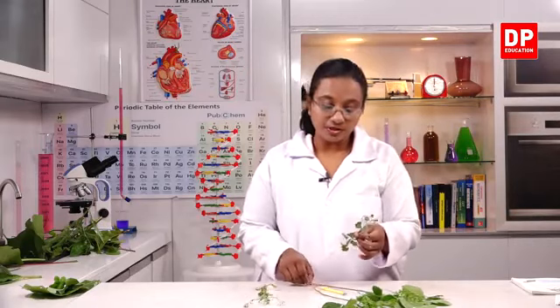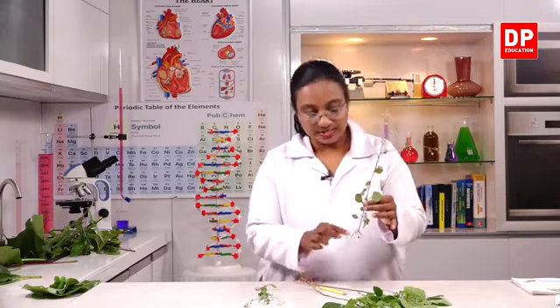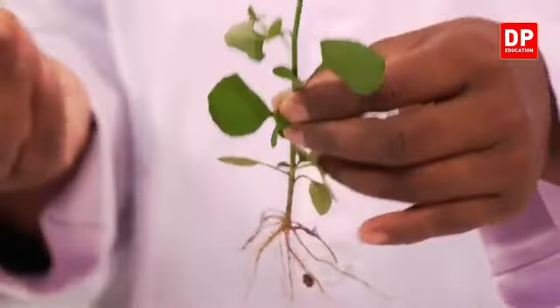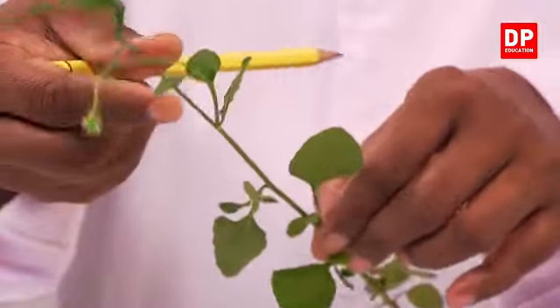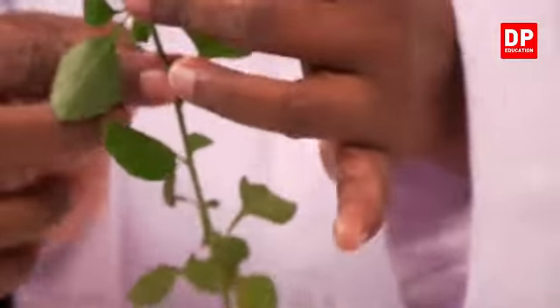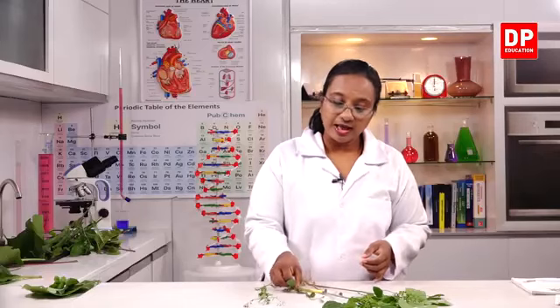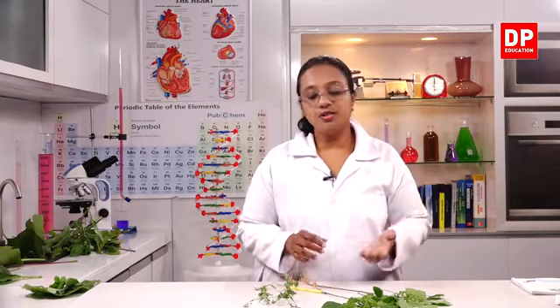Then I have another plant here. This is the Monara Kudumbia or the Seedaviyar Sangalanir. Here also you can see the root system and the shoot system, and you can see the leaves, and also in this stem you will be able to see the branches. Although that's a small plant, you can see the branches here, and the flowers also can be seen. So you can have buds, flowers, fruits, all those as part of the shoot system. I'm sure you all know all these parts, and we have recalled what you learnt in your previous grade.